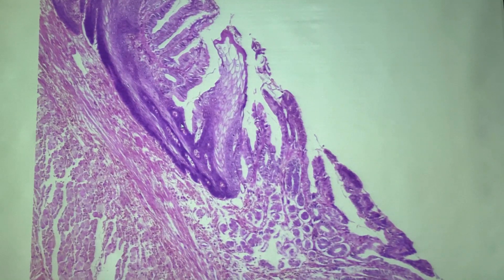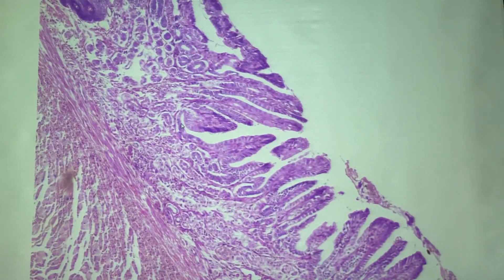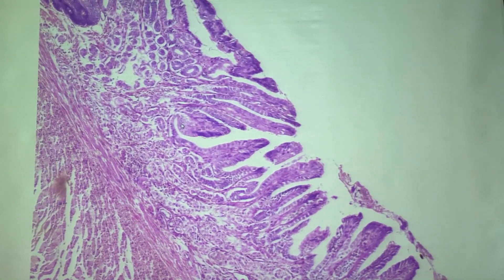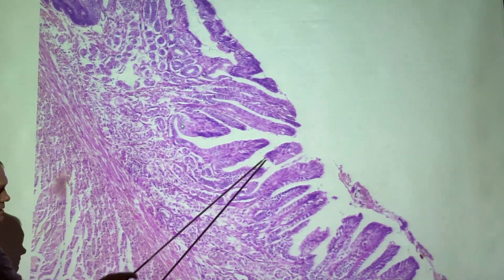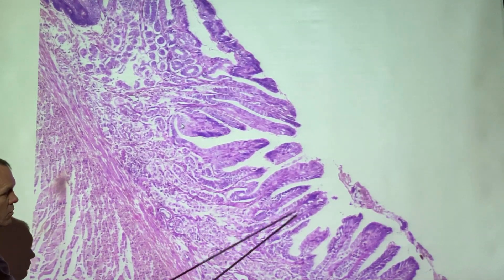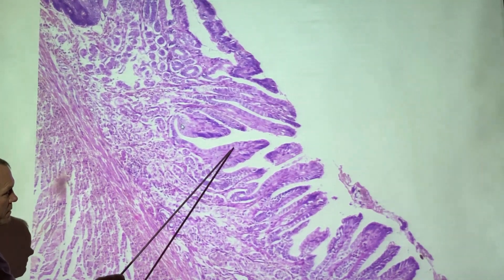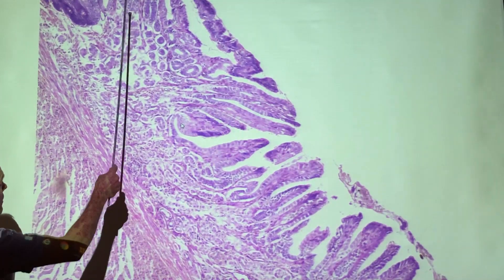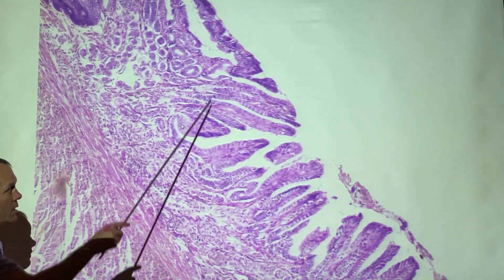You can see it's starting to change pretty dramatically—by this point we're now solidly into the stomach. You can see that the surface looks considerably different, and when we zoom in you'll get to see that these are simple columnar epithelium cells. You might be able to see it there, but up above was stratified squamous epithelium.